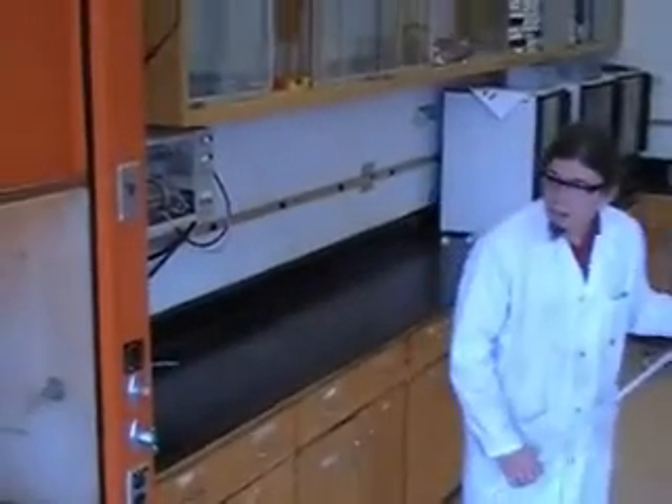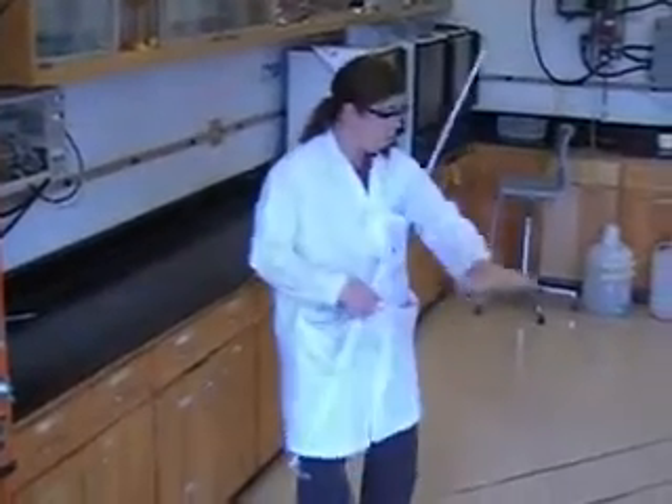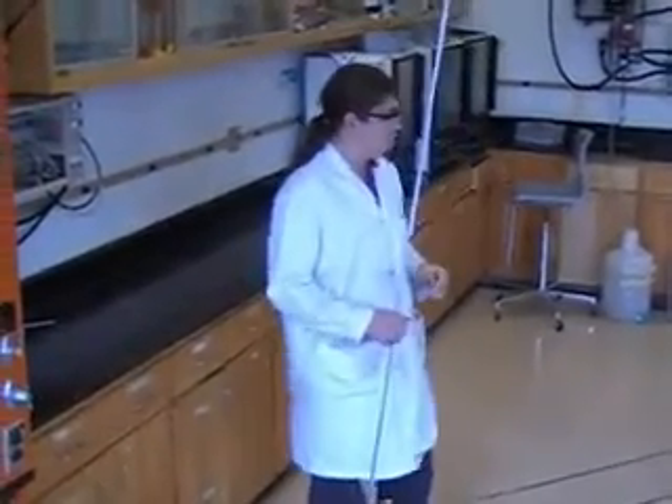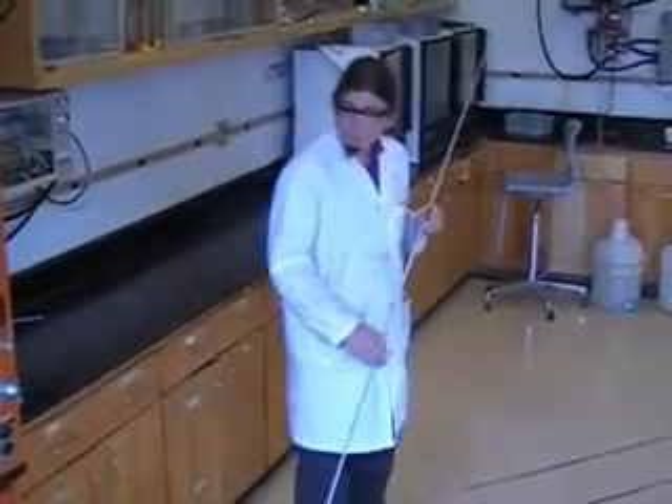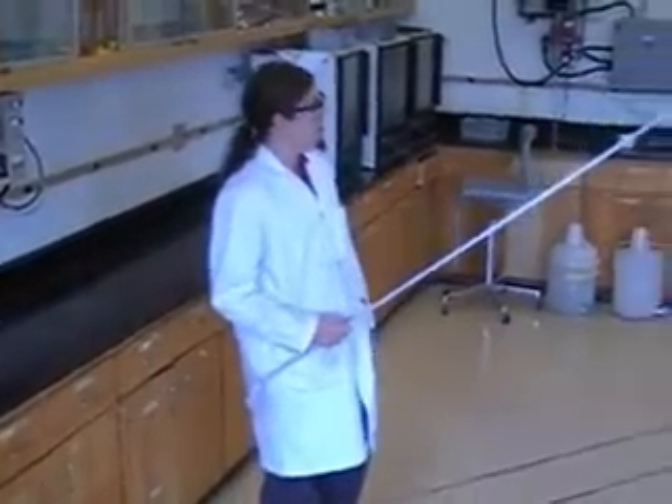Alright, so that's the second explosion. The next demonstration is over at the other end of the room. The stuff in this fume hood is nitrogen triiodide — or, if you want to be technical about it, it's an ammonium complex of nitrogen triiodide. The good thing about this one is it's so unstable to decomposition. You can come out round the front if you need to, but you will see fine from over there.